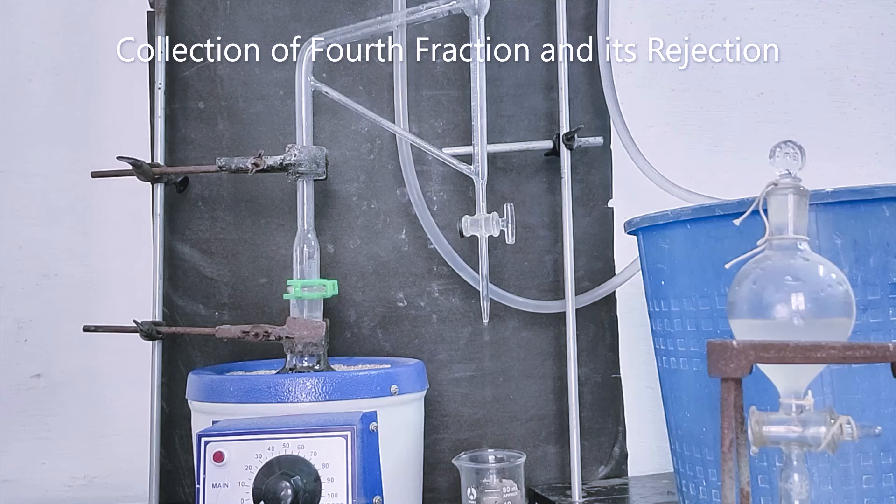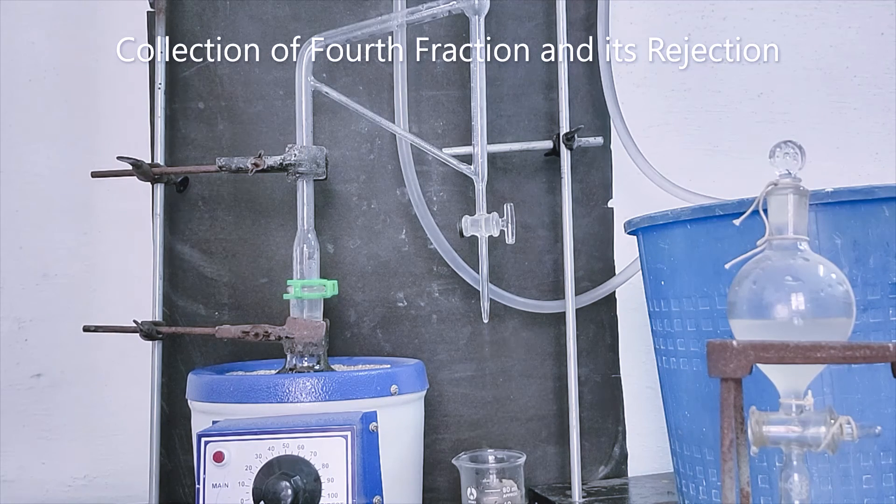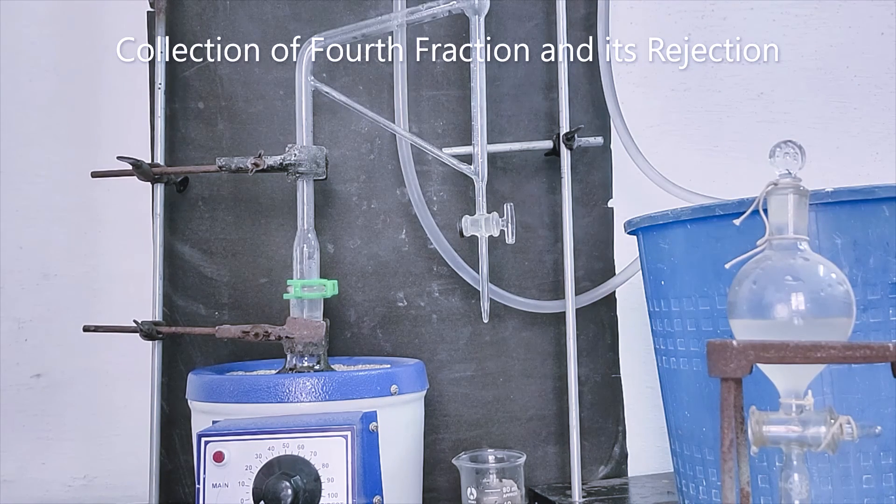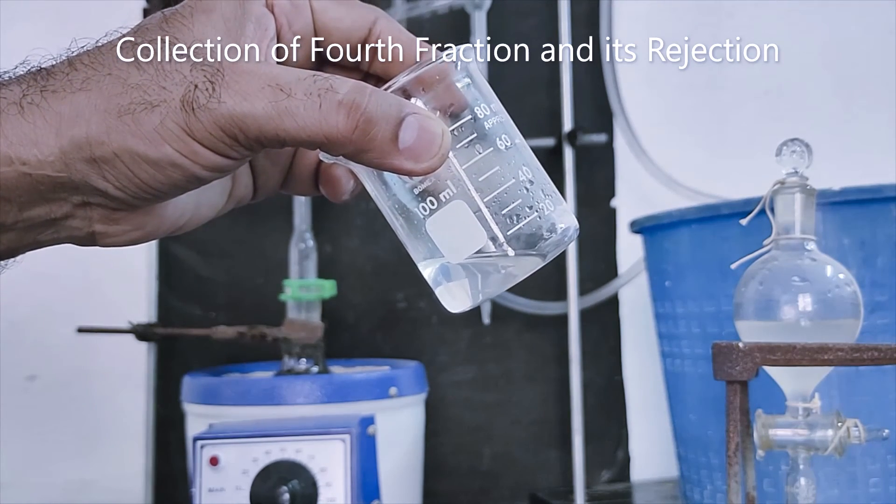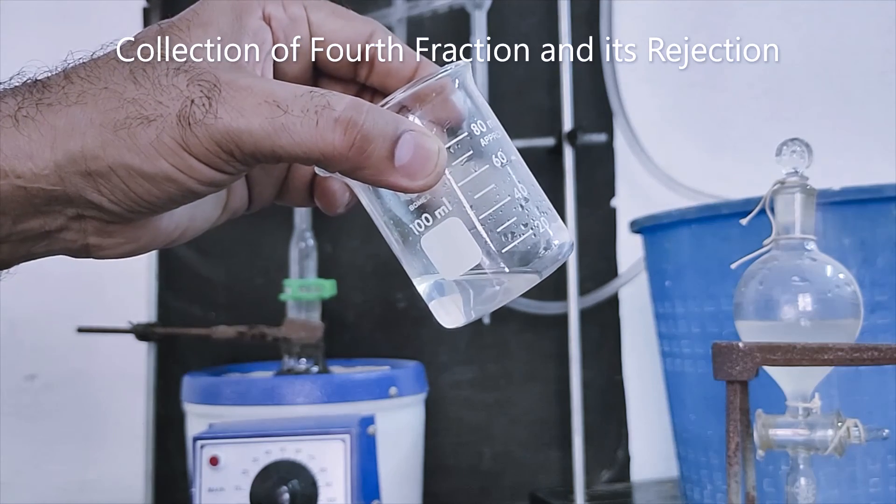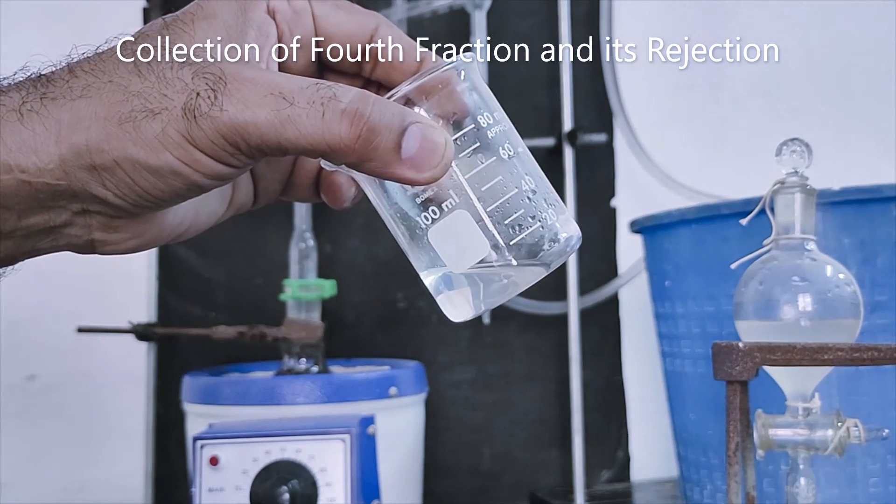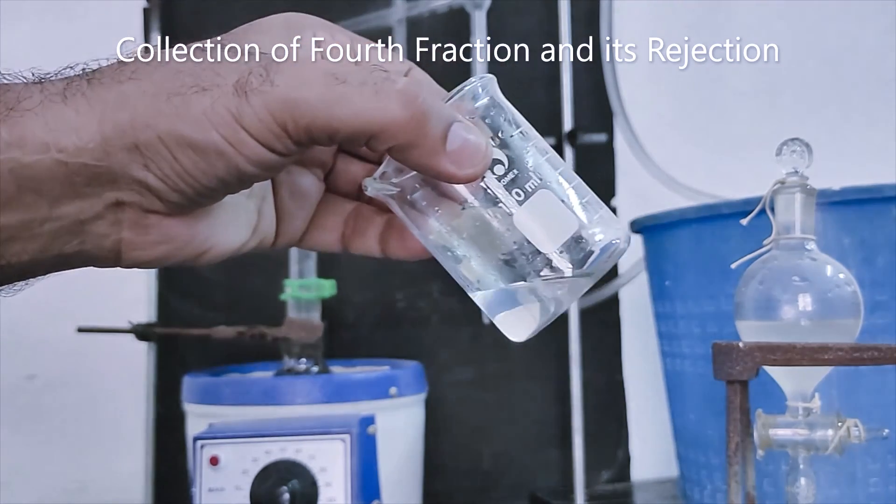This is the end of extraction process. This fraction is more transparent. That's why less amount of essential oil. Fourth fraction. I can discard it.